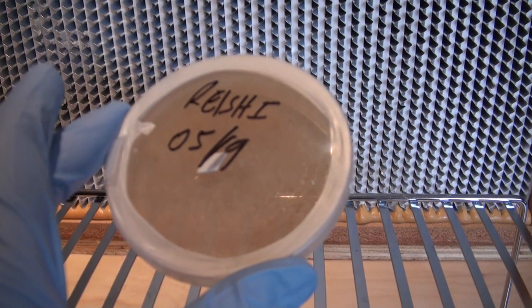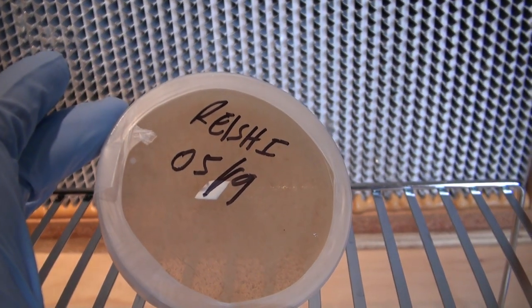Transferring mushroom cultures on agar is relatively easy to do, although it does take some practice to get perfect. But once you learn how to do it, it's a super useful skill.